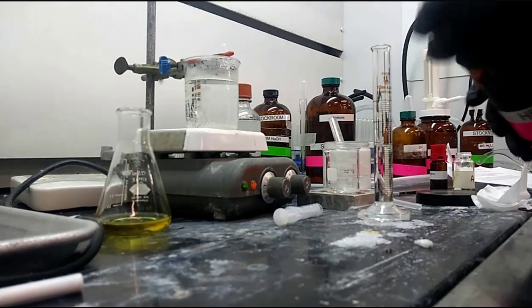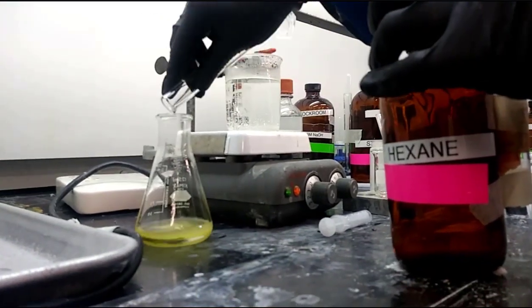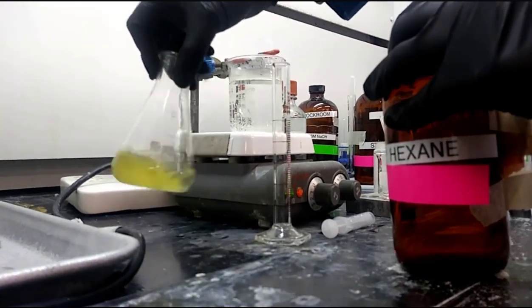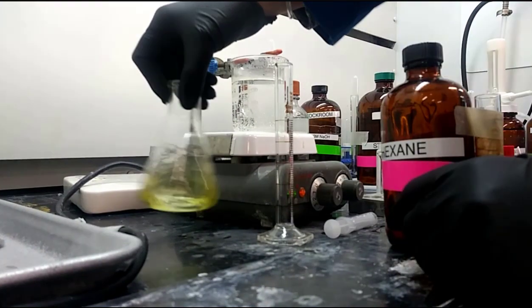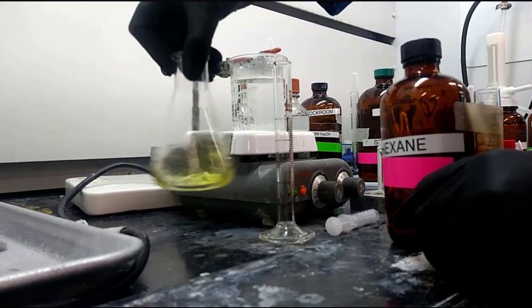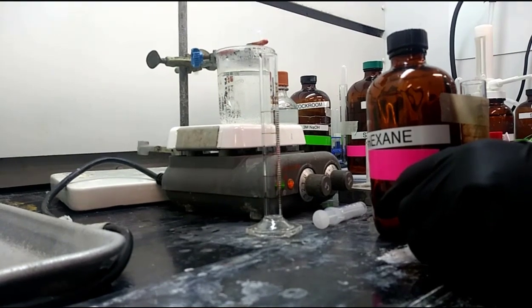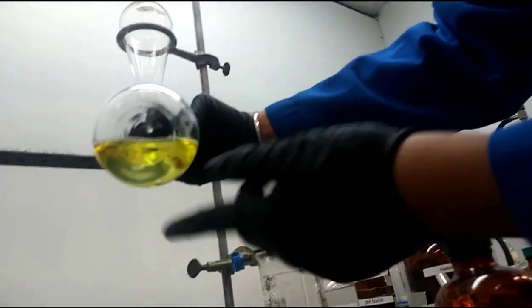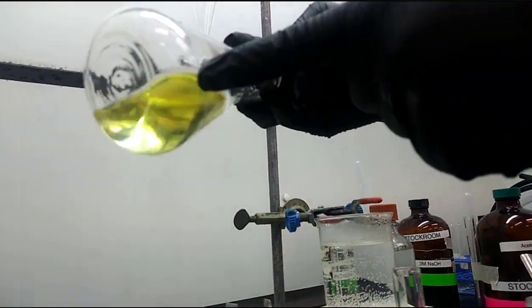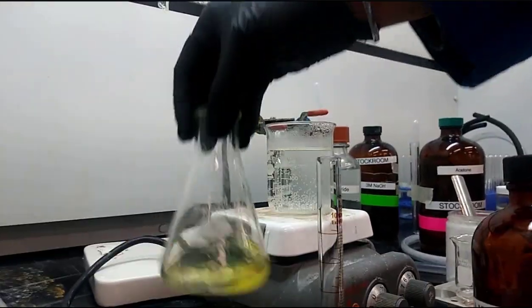All right, and so what they're going to do, they're going to take 6 milliliters of the hexane right now, and they're adding it to the Erlenmeyer flask. And they're shaking, shaking, shaking. Right, you want to do some shaking so that you can try and get those two phases, the aqueous and organic layer, intermingling, and have some of that alcohol go into the hexane layer. And so there are 2 layers. There's a bottom layer and a top layer.